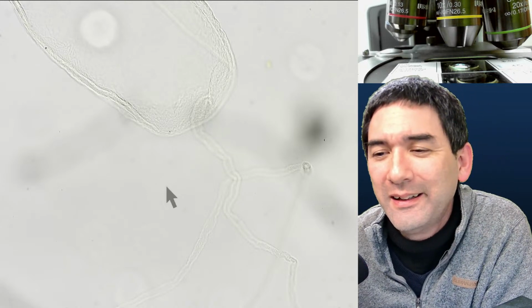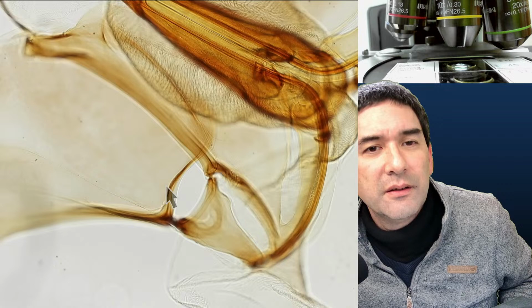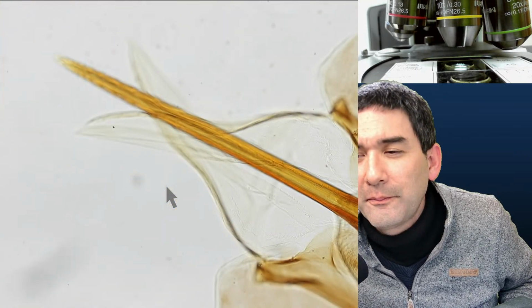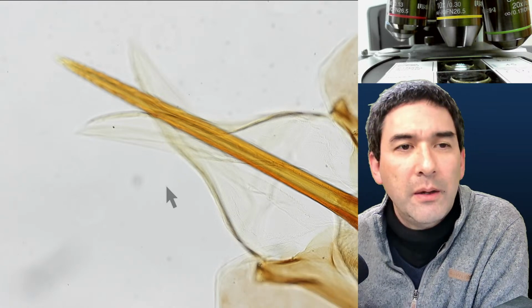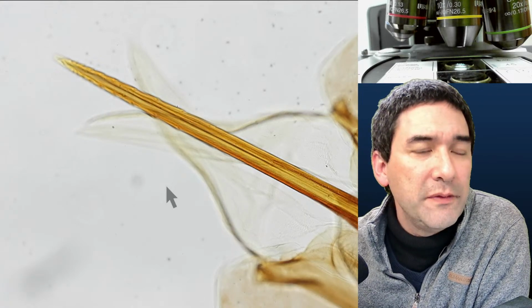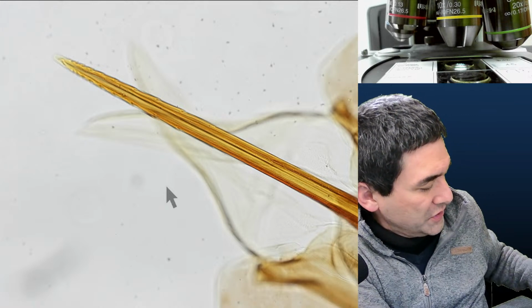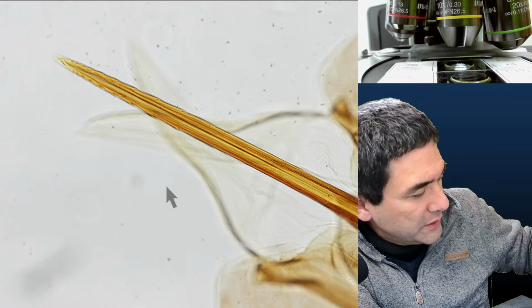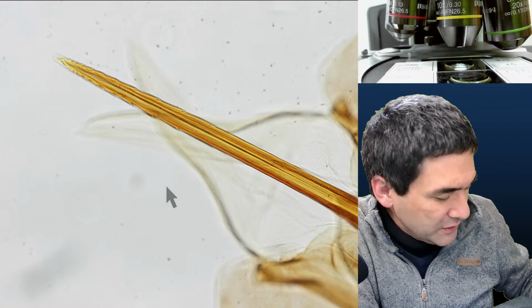Where's the stinger here again? Here it is. That's the bee stinger. I wish I had the guts to watch insects under my microscope. As a matter of fact, I think that if you're specifically interested in insects, then I can highly recommend stereo microscopes, because they do not require a lot of preparation, and essentially you can put the specimen directly under the microscope.